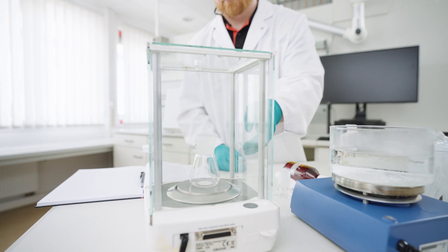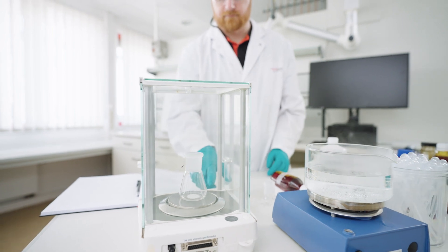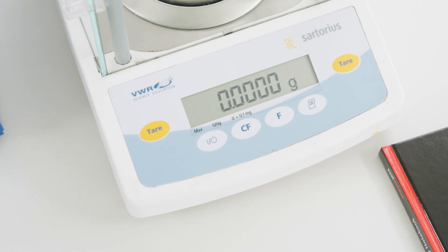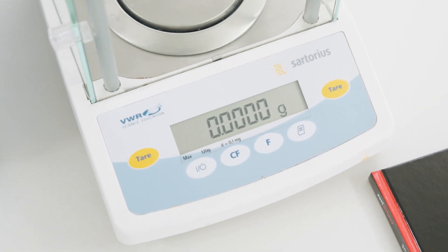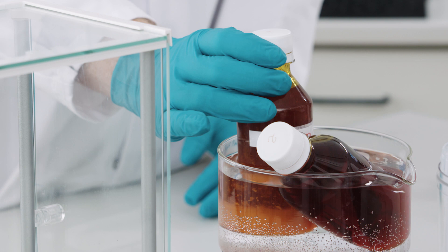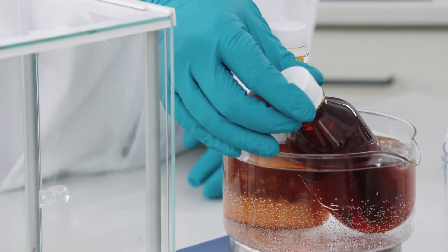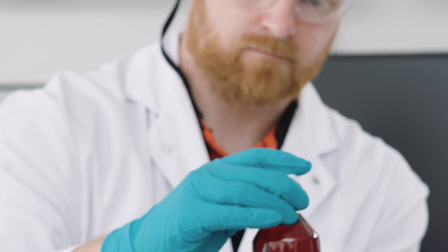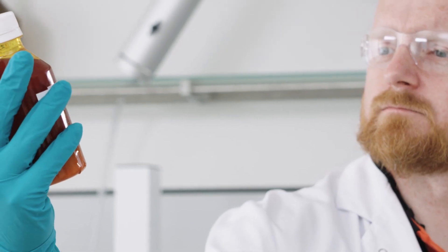Analytical balances are important tools for preparation of standard solutions, weighing in the samples, or preparation of solutions and dilutions. The balance should have at least 0.1 mg precision in the display. Inhomogenized, viscous matrices such as wax or palm oil need to be homogenized by melting before further processing; for this purpose, a heated water bath or ultrasonic bath is used. For the separation of matrix components, extraction is well established.